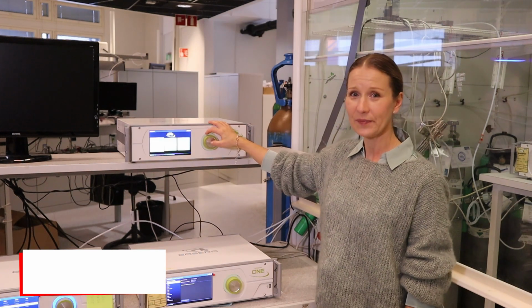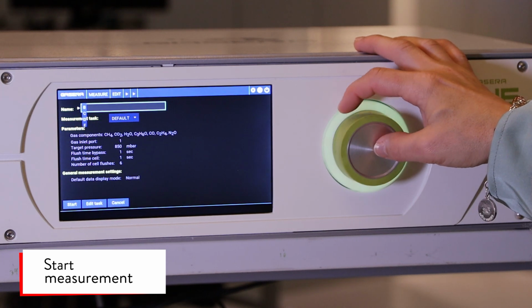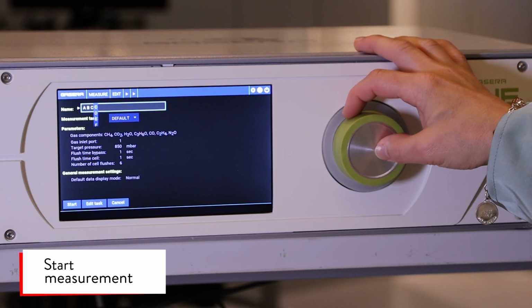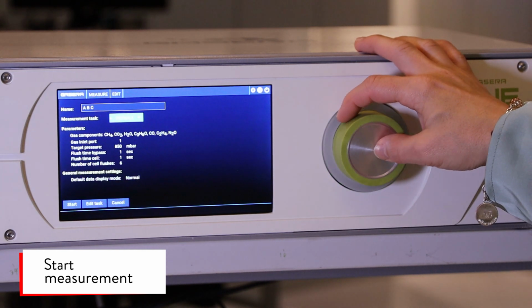Back to the UI. Now we can start a measurement. We can select a name for the measurement. For example, we can select A, B, C, and with a long press you can get out of the cell and then choose a measurement task.